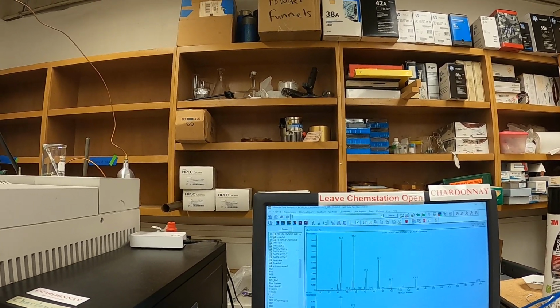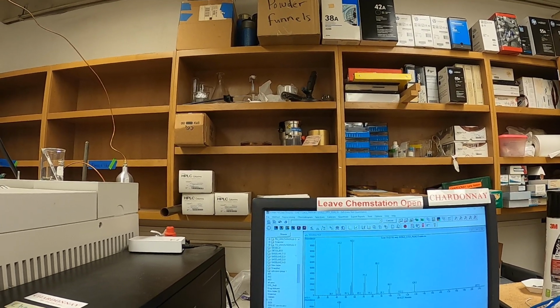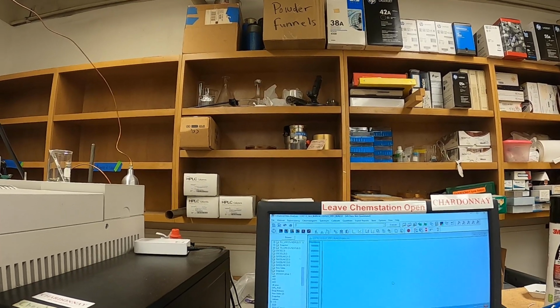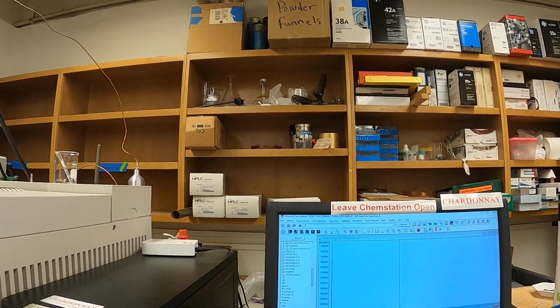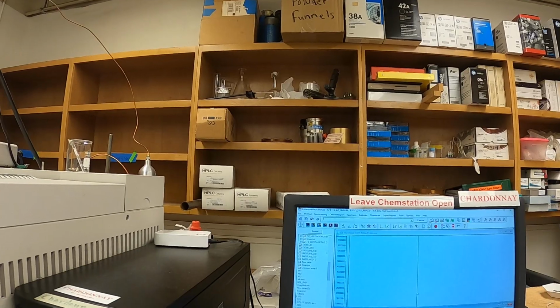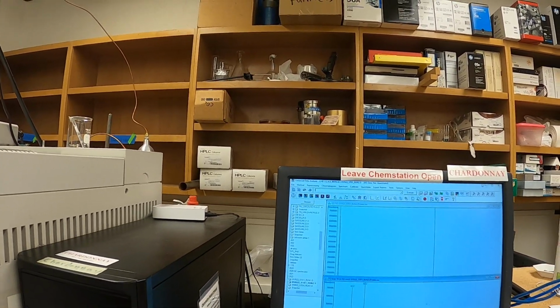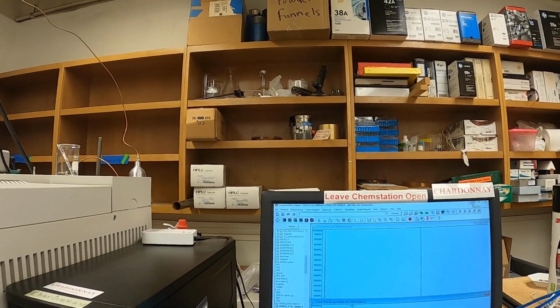All right, so that's pretty good. 0 to 50, you know, you take it with a grain of salt. All of them you have to take it with a grain of salt. Do you see your molecular ion? Does it make sense? Do you see the right fragments? Under 50, not very believable. But I've seen standards come out at 30, 27. You know, 50, 85, believable, but still, do you see your right molecular ion?